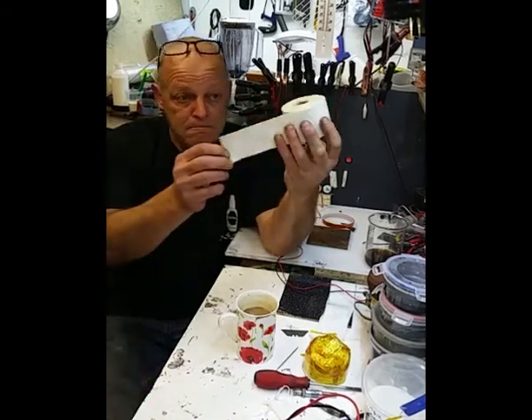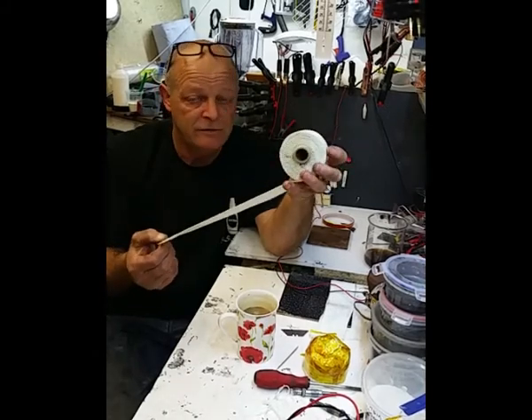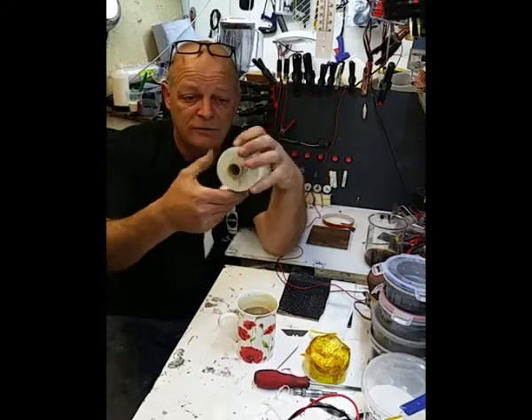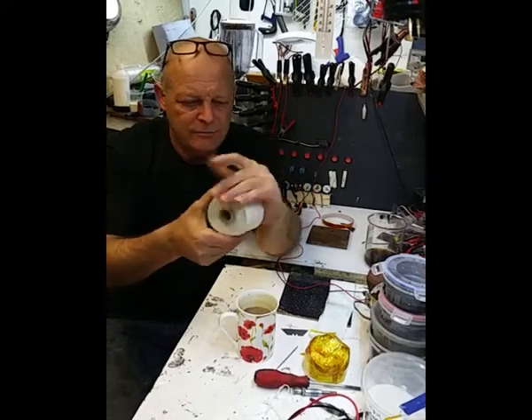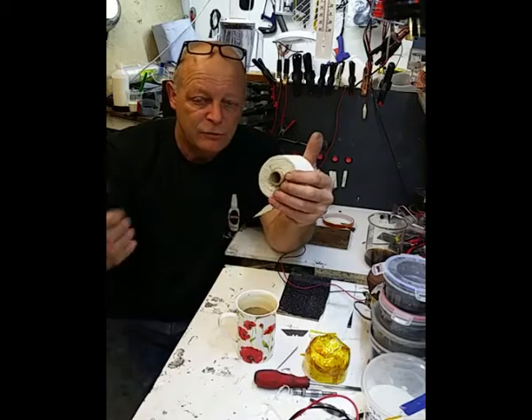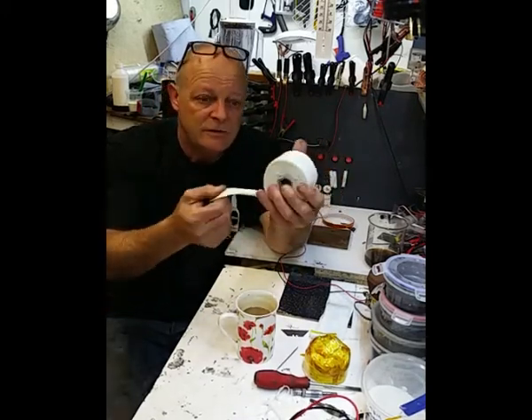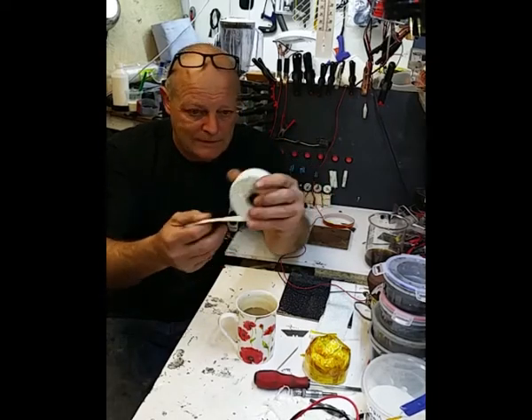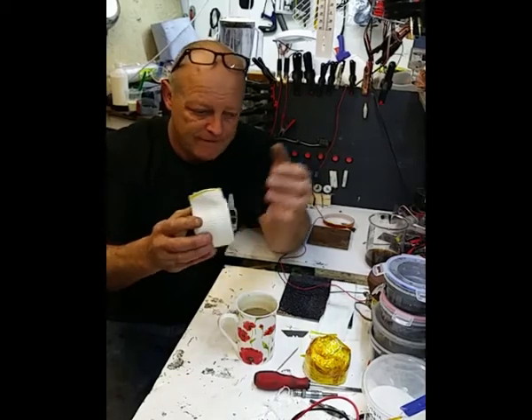Now this is just, you buy it on eBay. I think this costs £5 for a big roll, and it's exhaust heat wrap for cars. They use it a lot on high performance cars, to wrap the exhaust to keep the heat in, and it ups the power and all the rest of it. But I've got this. Now that's what I've used. I'll show you in a minute.